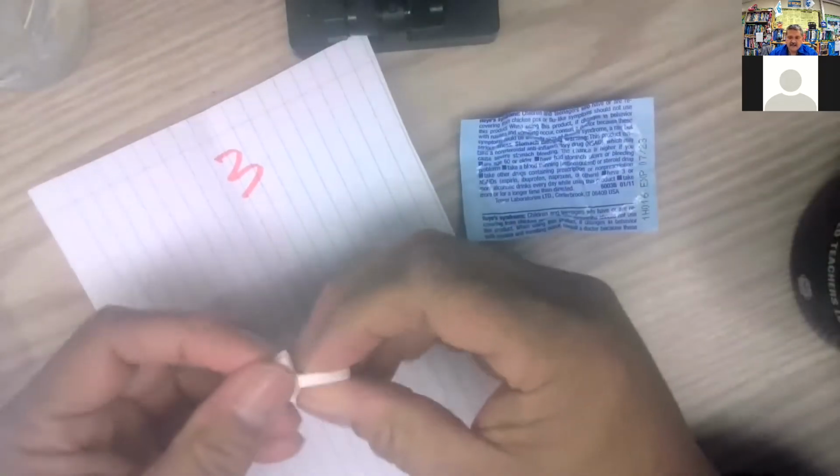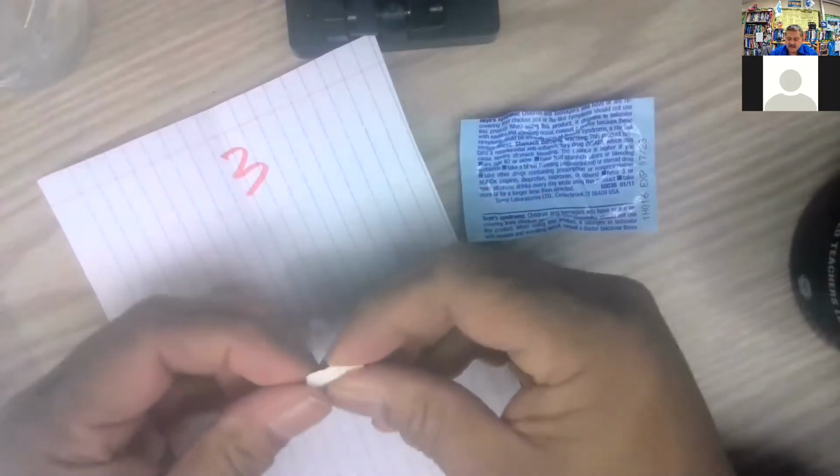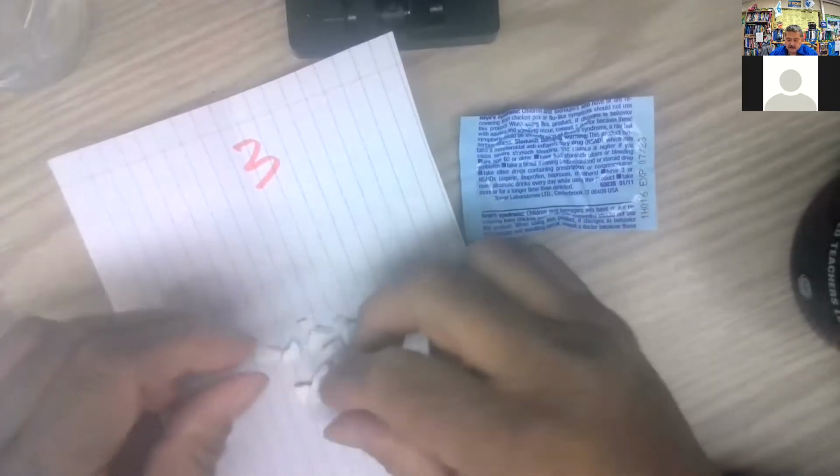Okay, so now I got 2 out of 3, and then I got this one right here. So crush this up a little bit before I pound it to death with the coffee mug. All right, small.